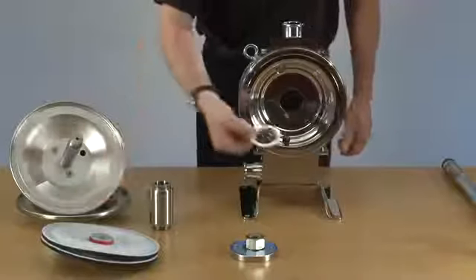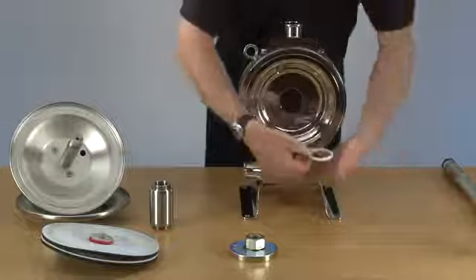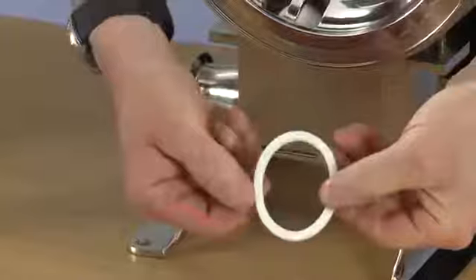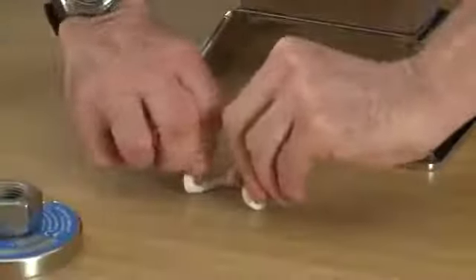Now ready to replace the divider seal here, first of all. Squash the divider seal into an egg shape and bend.